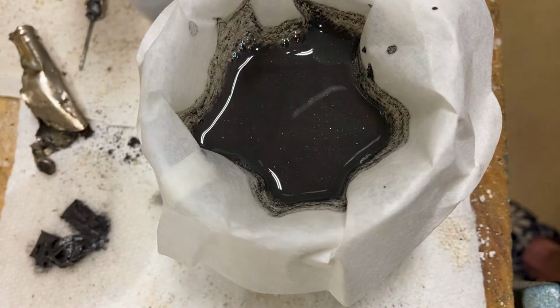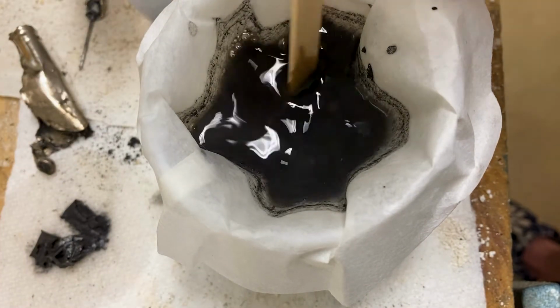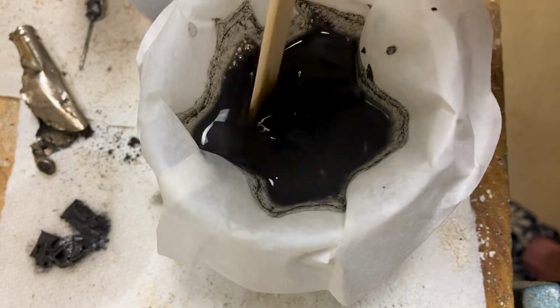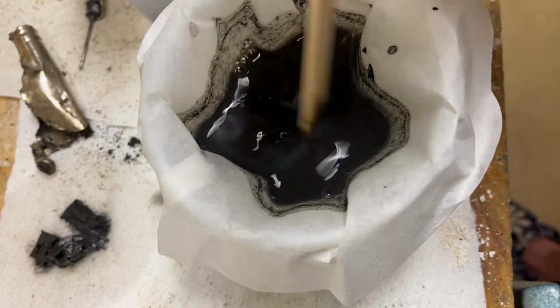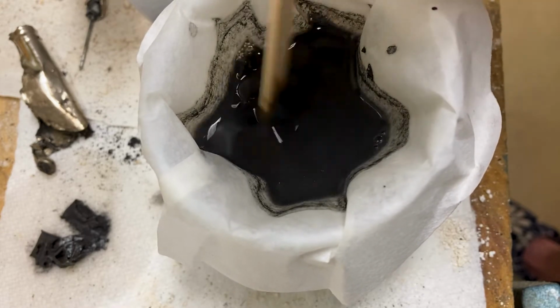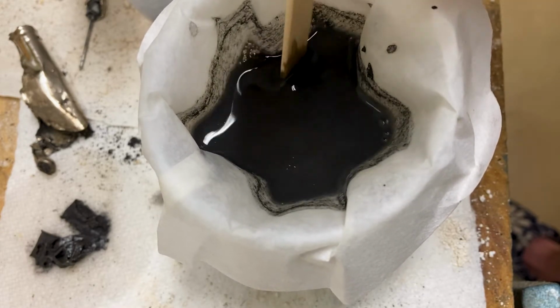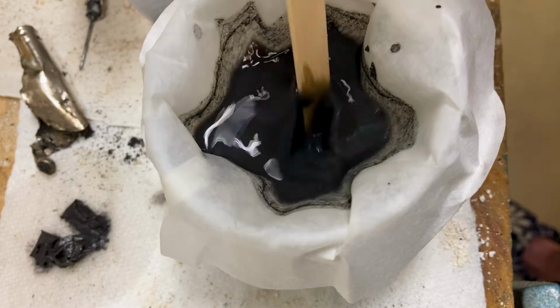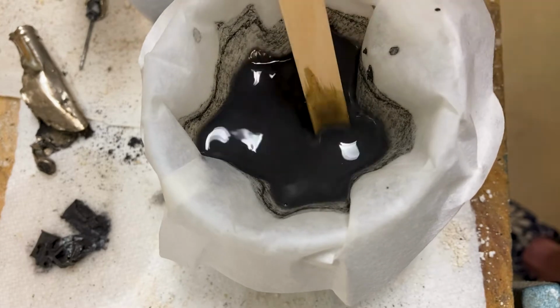I know there's permanganate that I could make, which is a fairly safe and powerful oxidizer, so I don't know, it might be worth looking into that, but I think for right now I'm just going to treat that more as a distraction, and I don't want to bother doing anything with that.